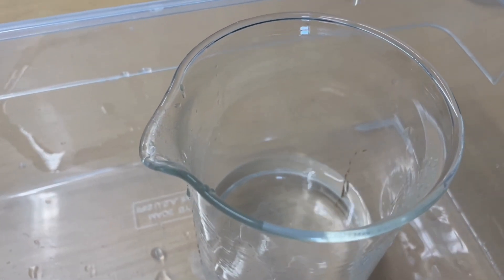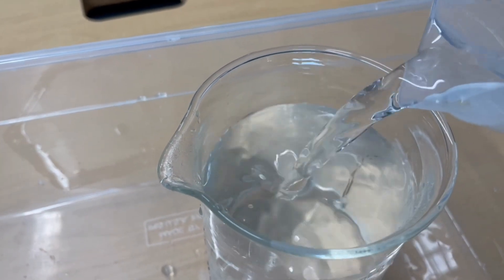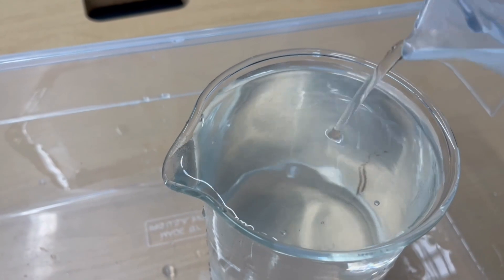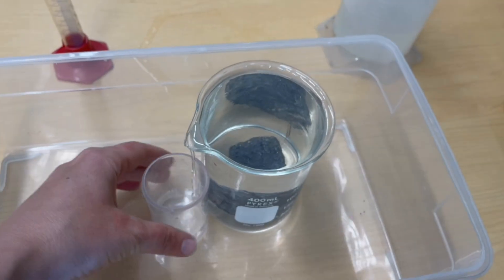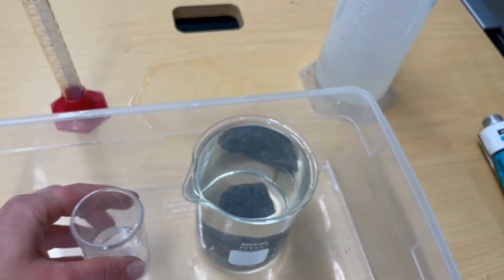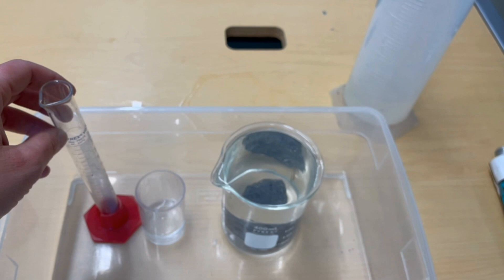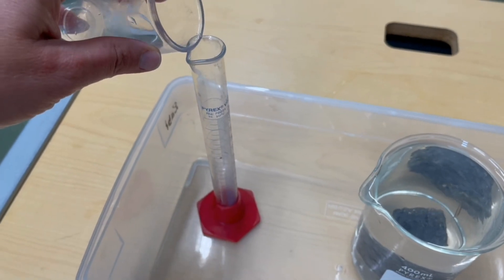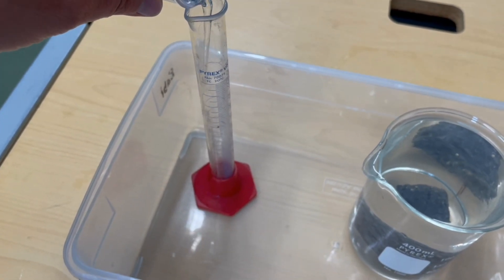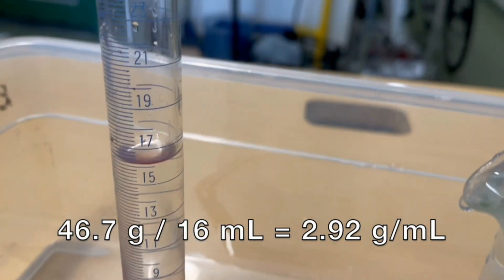Your smaller container goes right under that spout. Then to set it up, you need to fill it with water to the point that it literally could not hold any more without spilling over. When you put the rock in, you want to make sure that only the rock touches the water, not fingers, and then you can catch all that water that spills out into your smaller container. Then use the graduated cylinder to measure the exact volume of that water. This is really sensitive, so it's important to transfer as much of the water into the graduated cylinder as possible. This is another oceanic rock, so its density is also close to three grams per milliliter.